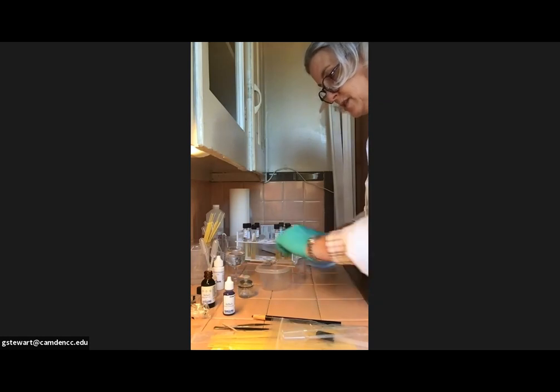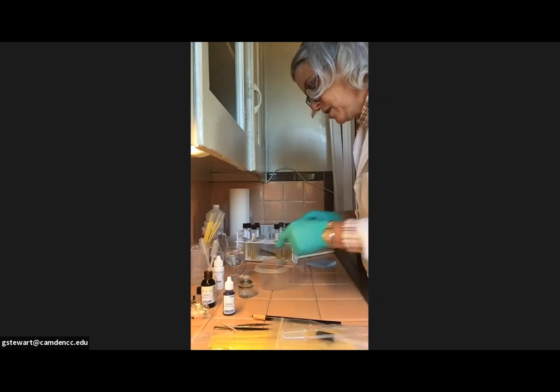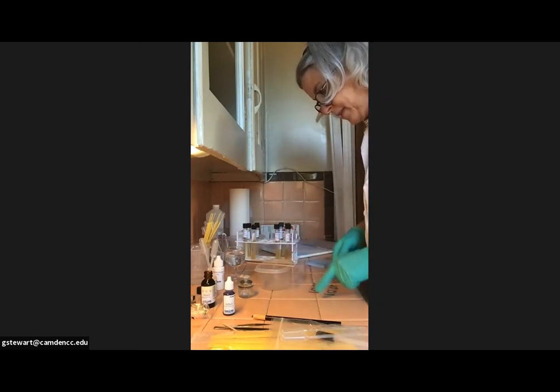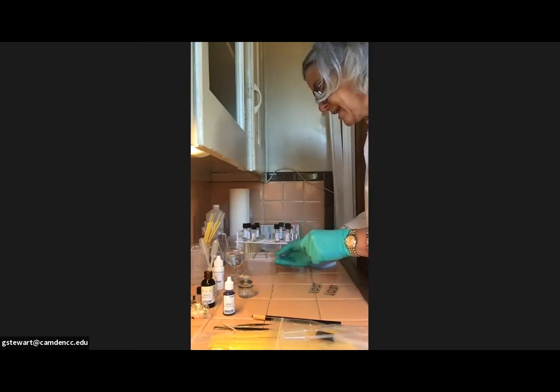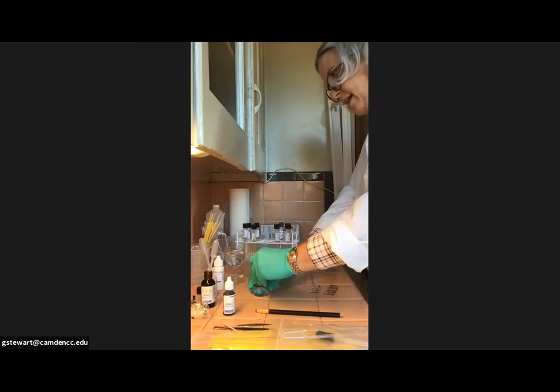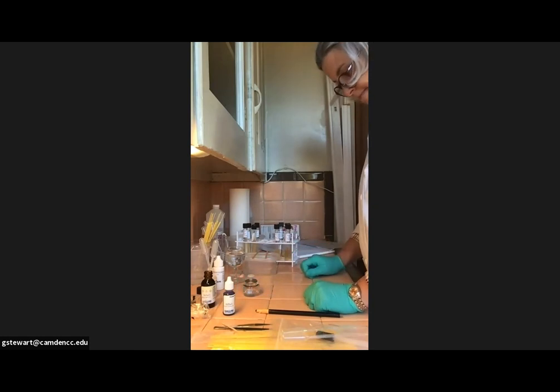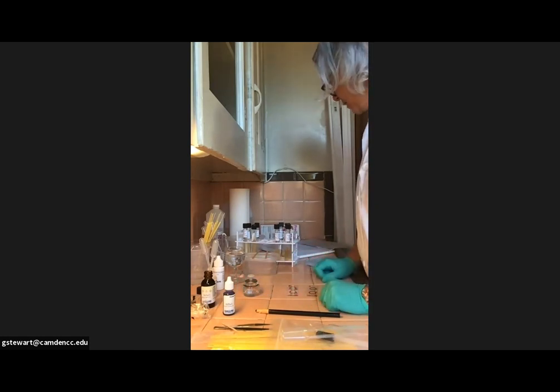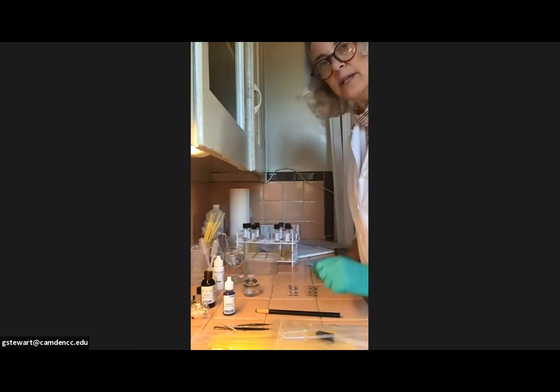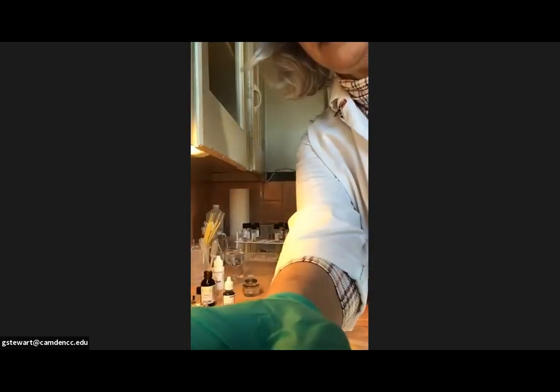So again, I'm just going to use this for my staining procedure and I'm just kind of checking out how it's going to work. It looks like it's going to work fine. And then I'm going to kind of set this aside. I believe I am going to have to light my paraffin burner and I forgot my lighter. So we're going to take a short pause here where I'm going to stop recording and run downstairs and pick up my lighter.